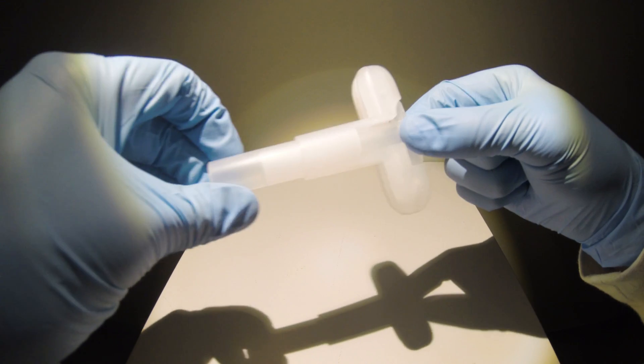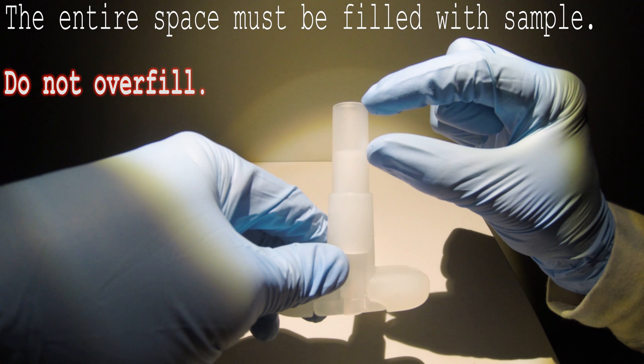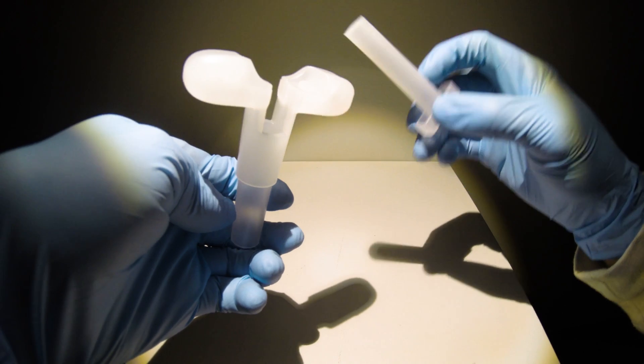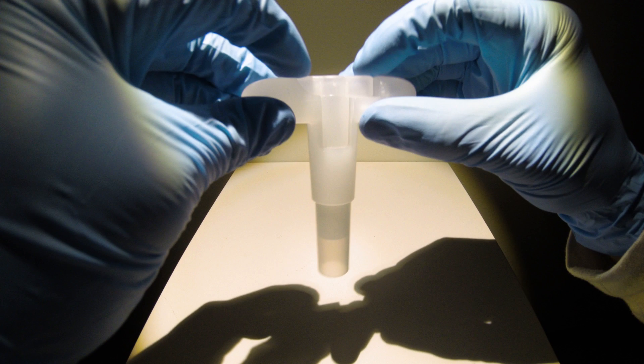Your TerraCore sampler arrives ready to sample. The hollow space at the bottom of the sampler will collect the necessary quantity of sample. Have the plunger sitting in the sampler as it arrived, as shown here.